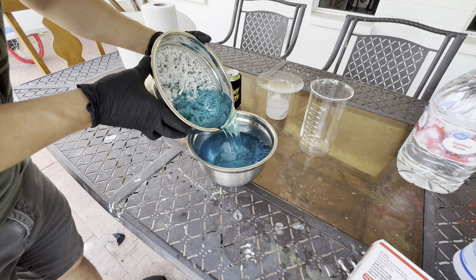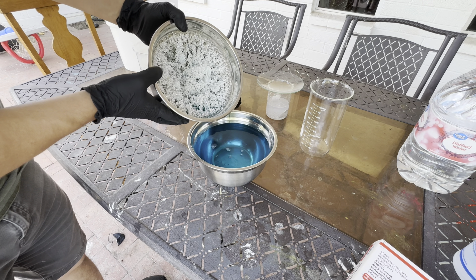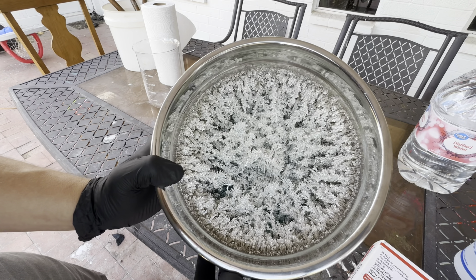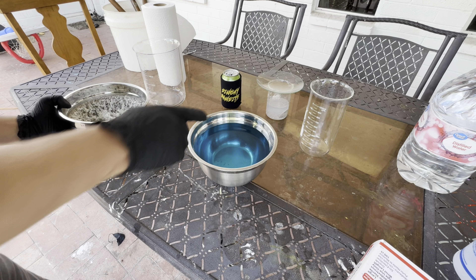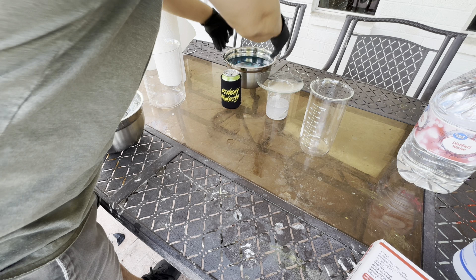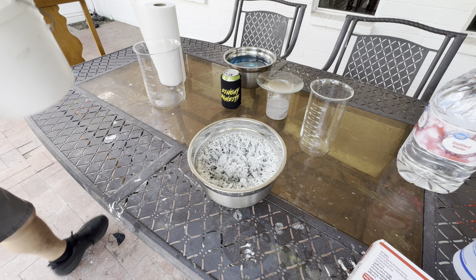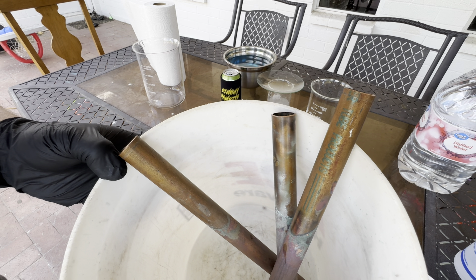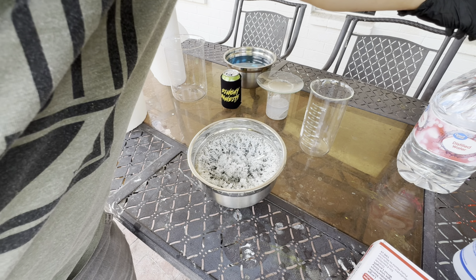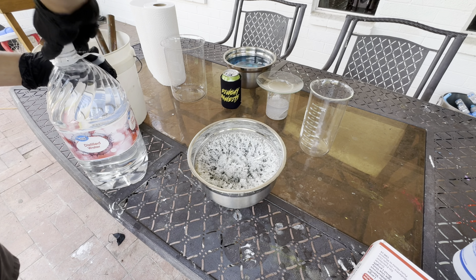I'm going to pour that into this bowl. There's our first look at the crystalline silver. There are some pieces in there. We'll set this aside and reuse this to run the rest of the silver that I have. In this bucket I've got some copper pipe, and we will do our several rinses and pour them into this bucket. It'll drop out any silver left in the silver nitrate for us to recover when we cement it out.